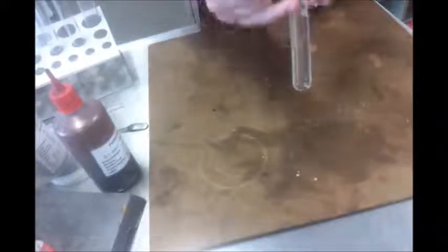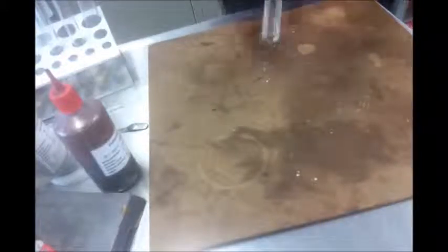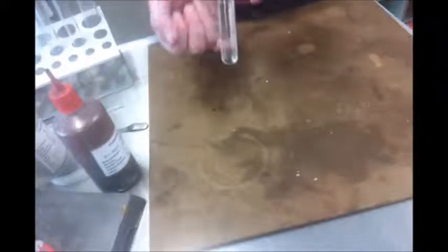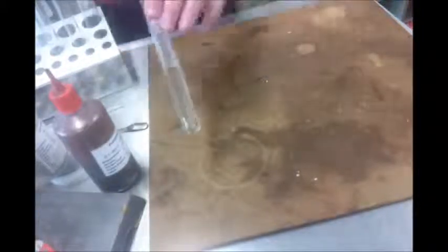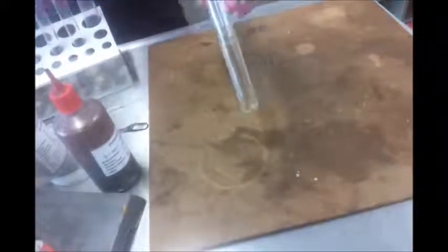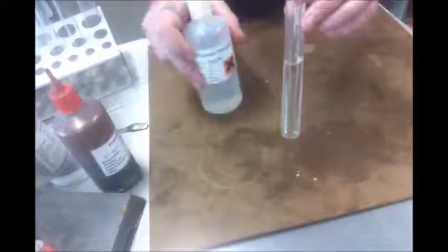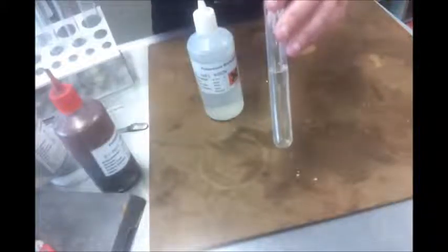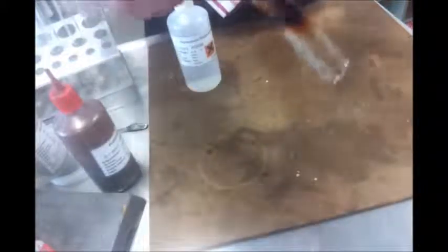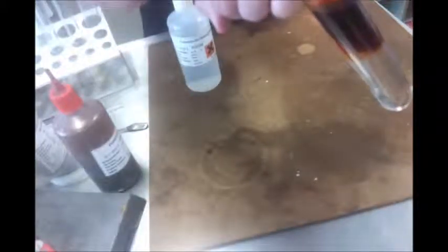The iron in here, the iron 2+, is also changing. But iron 2 is quite special. It can either turn into iron metal, and maybe there is some iron metal in there, the particles are just too small for us to see, or it turns into iron 3+. Well, we might remember from earlier in the year we had a test for checking if iron 3+ was present, and it was this stuff called potassium thiocyanate. It makes a complex ion with iron 3, but not with iron 2. And the colour of that complex is blood red. So we know that the iron 2 has turned into iron 3 because of this blood red complex being formed.